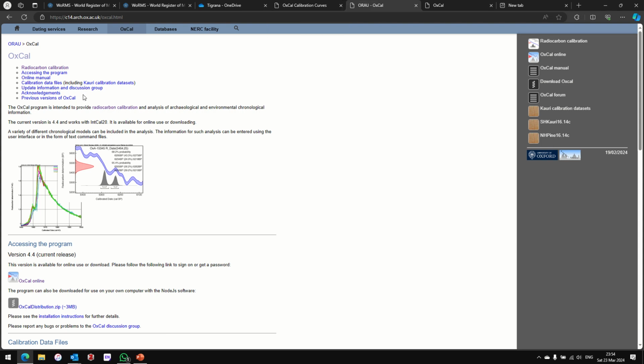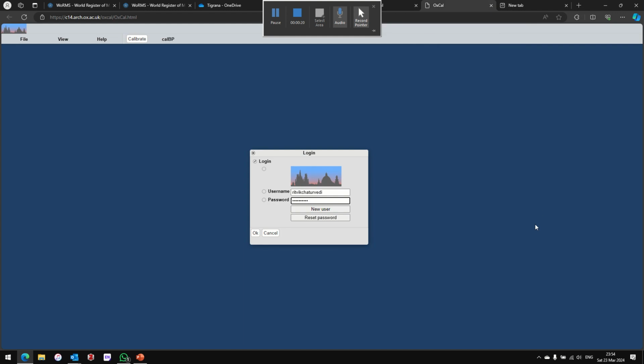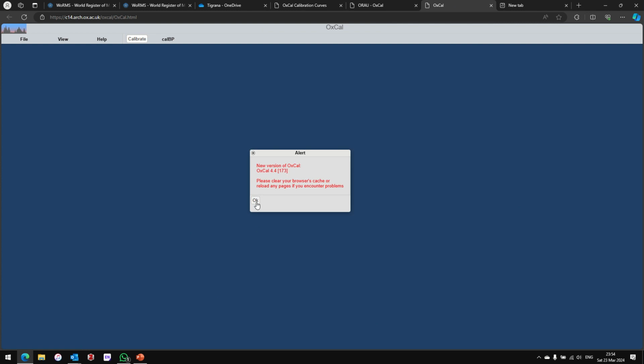Hello, this is a video regarding the problem I'm facing with calibrating my raw radiocarbon ages. So I'll go to the OxCal online software program and I enter my username and password. It opens up a window. Enter my username and password, and I go to calibrate.